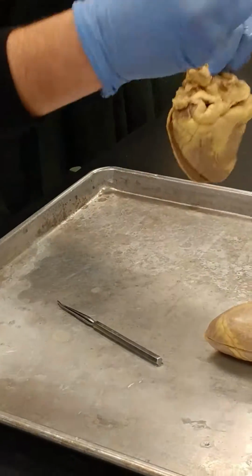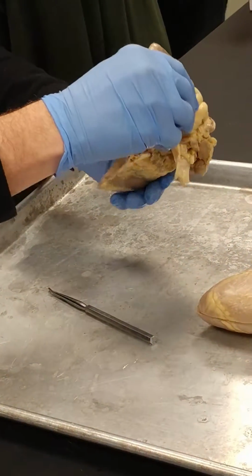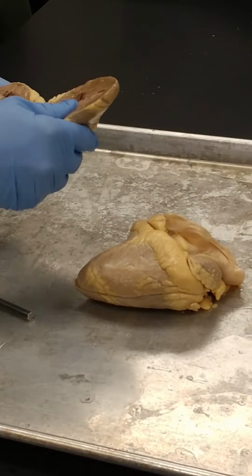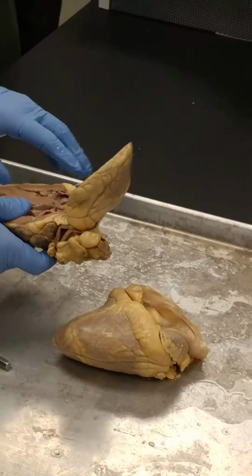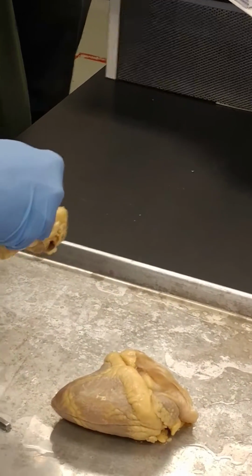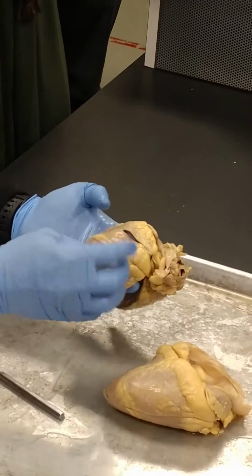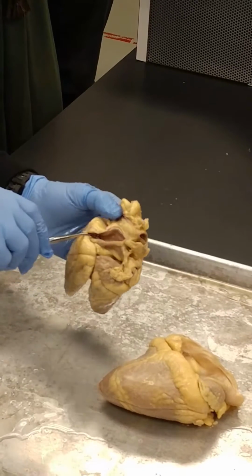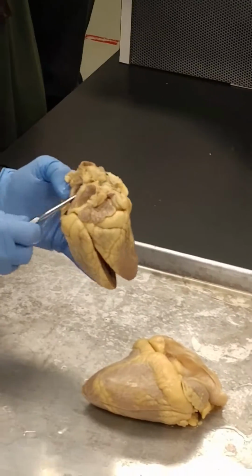Auricles. Pulmonary trunk. All right, so the pulmonary trunk is going to come out of this. The pulmonary trunk goes from the right ventricle up to the lungs. The way to find this, if I flip it like this, the right atrium and ventricle is on my left side, which is the way we typically want to see it. But how do you find the pulmonary trunk? Flip the other direction, and then you're going to take your finger and slide it up into this space, and you'll see they've already cut this. Okay, they've already cut so you can look in there. The pulmonary trunk is actually this vessel right here along that cut. So that's the pulmonary trunk. Remember, the pulmonary trunk goes to the lungs.